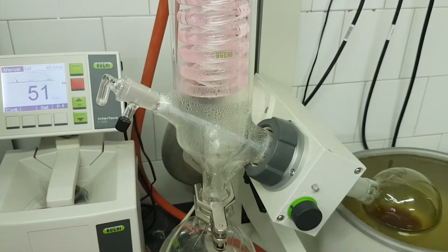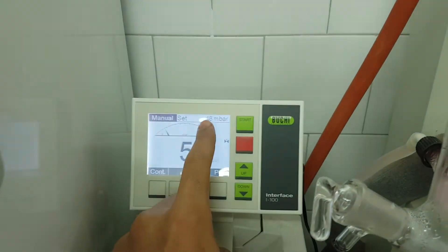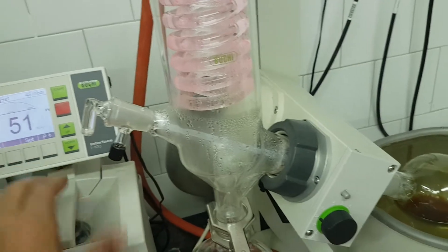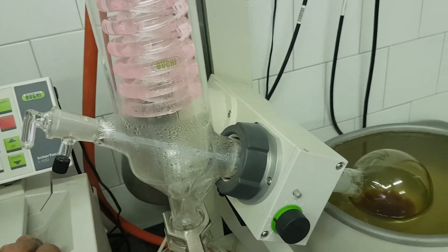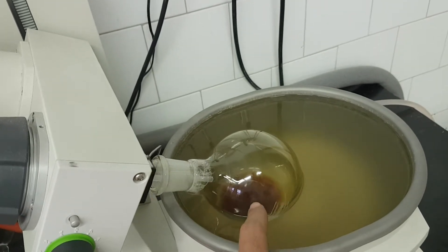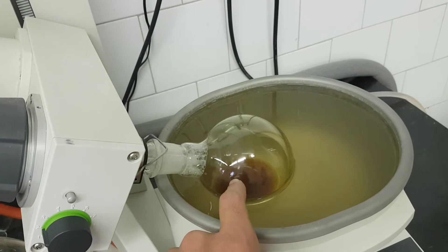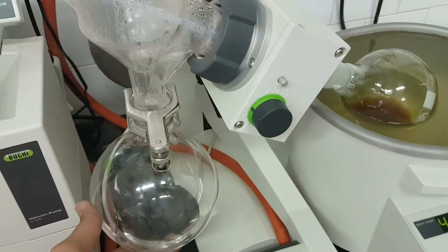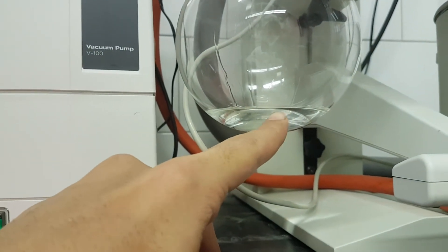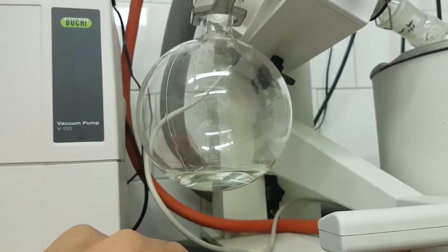In order to remove water by your rotary evaporator, you need to use low pressure. You need to keep in mind that you must go very, very slowly. If you go too fast, you will have a lot of bubbles inside the flask — those bubbles will carry substances from the liquid, and you will not have a transparent liquid. You will have your substances mixed in, which is not practical, as you can see here.